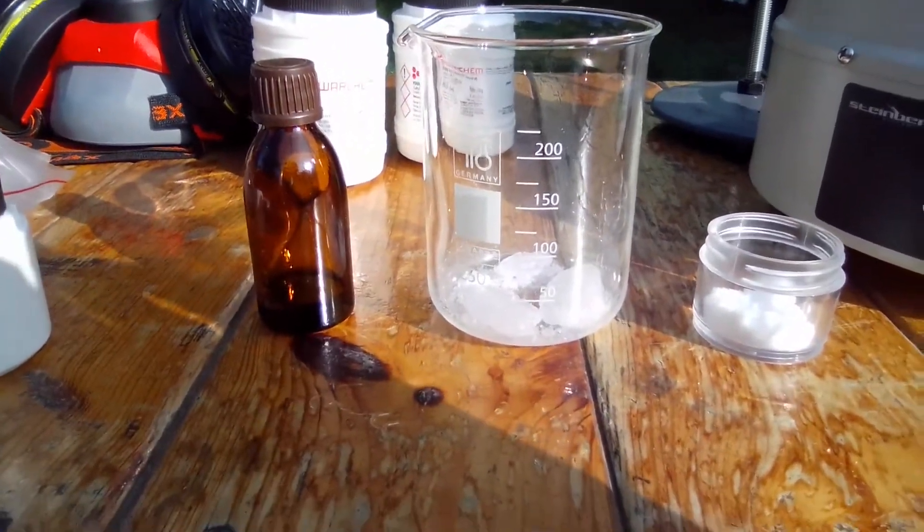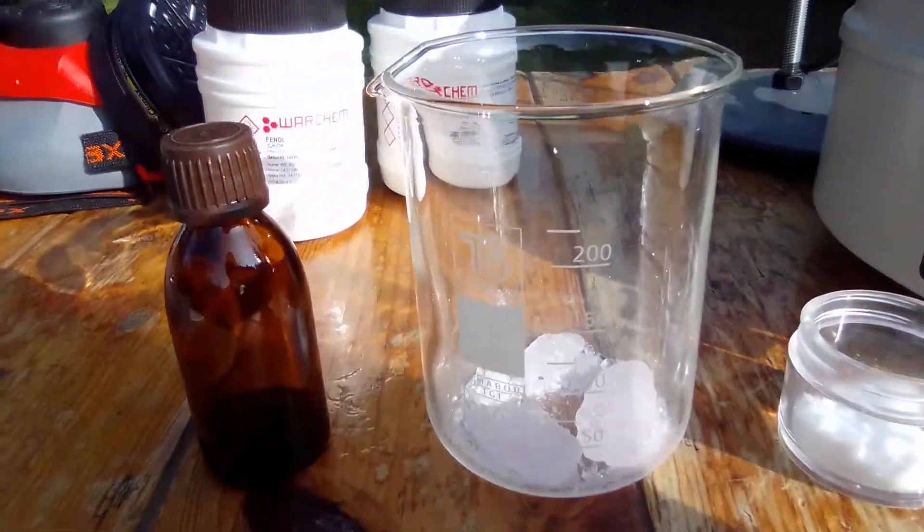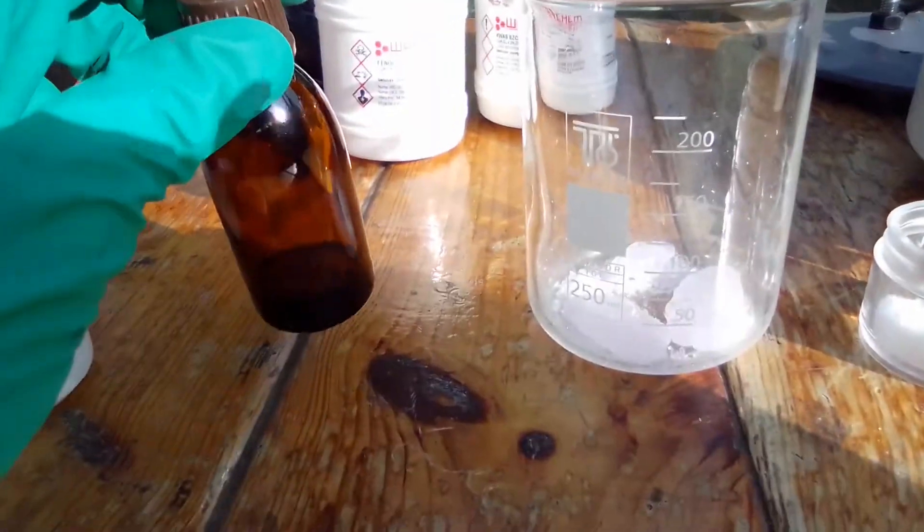Hello, in this video I'm going to try to make some Rosolic Acid, also known as Aurine.